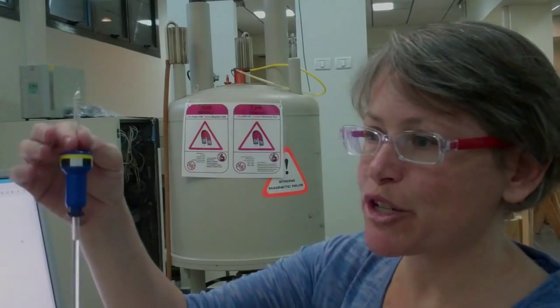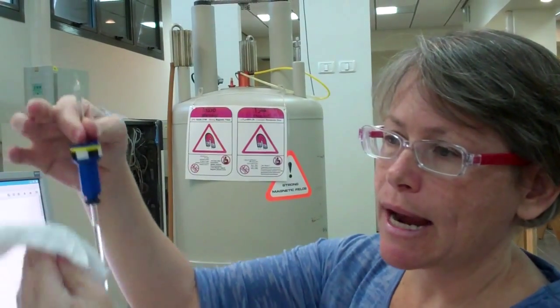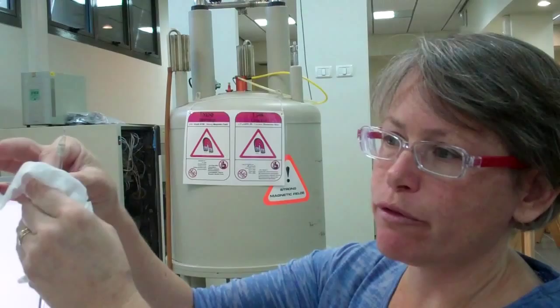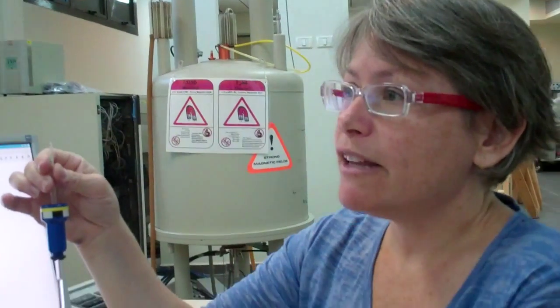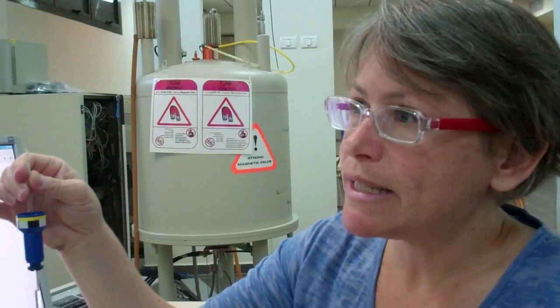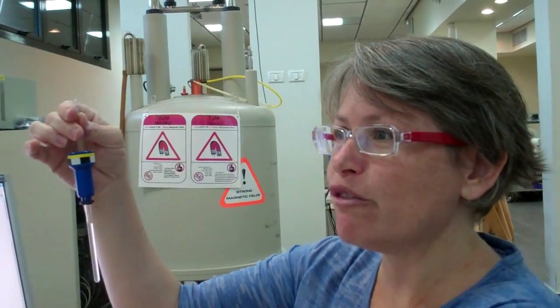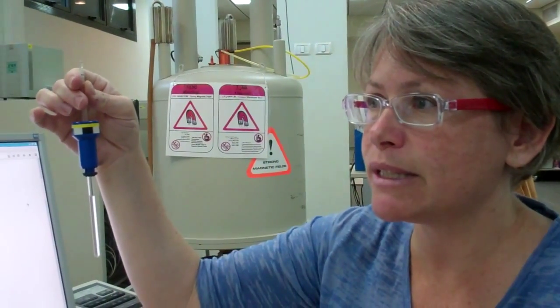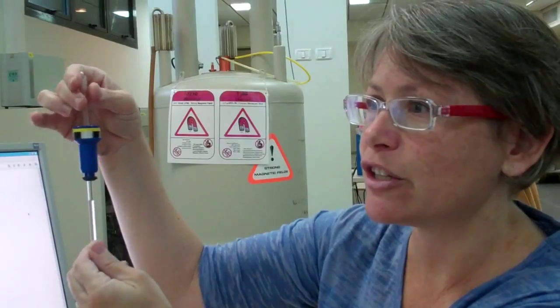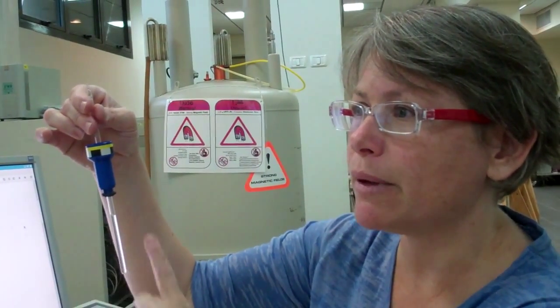Next, leave the depth measure behind. We have cloths around for wiping the tubes and the spinners in order to remove finger grease. If I touch my eyeglass lens, I leave a fingerprint that makes it difficult for me to see through my lens. When you touch the spinner, the fingerprint that you leave behind can interfere with the optical eye's detection of the spinning frequency. And dust likes to stick to accumulated grease inside, blocking the tiny air holes used to spin the sample.